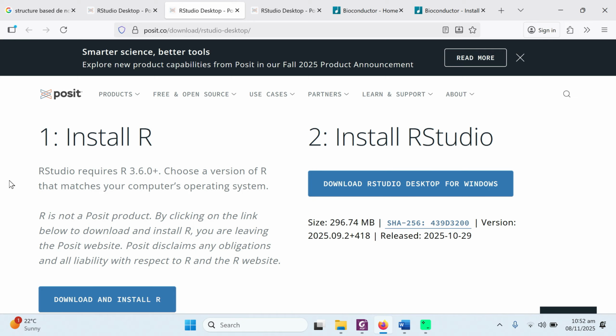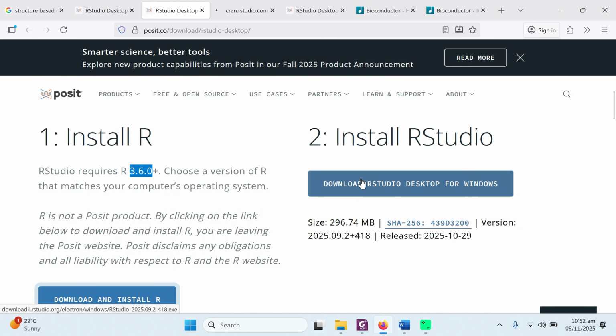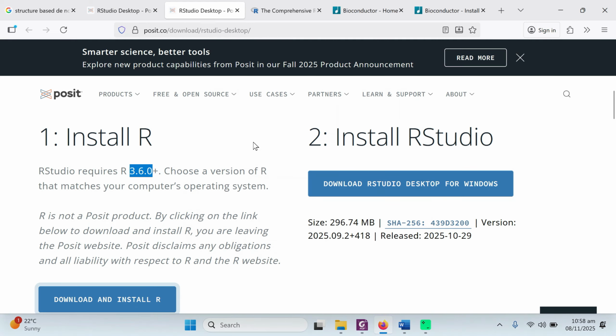R and RStudio are updated on a regular basis. When you try it, maybe it is showing a different version. Right now it is showing the 3.6 version. Maybe it has updated to 7, 8 and so on. You just need to download and install the latest version. Simply click on the download and install button from here, and then also from this one. This will lead to downloading of R and RStudio.